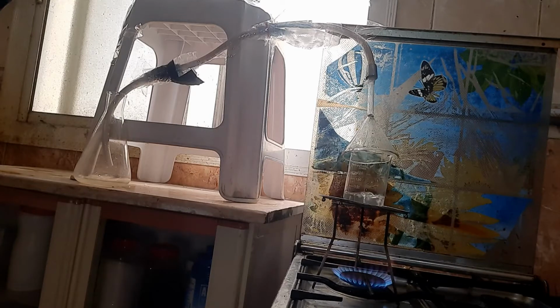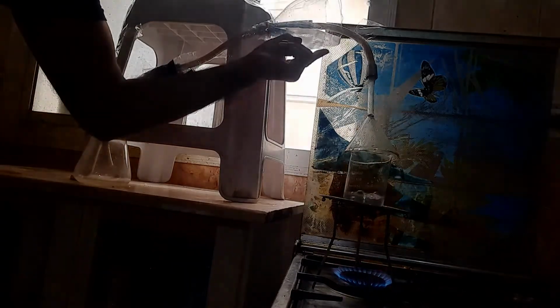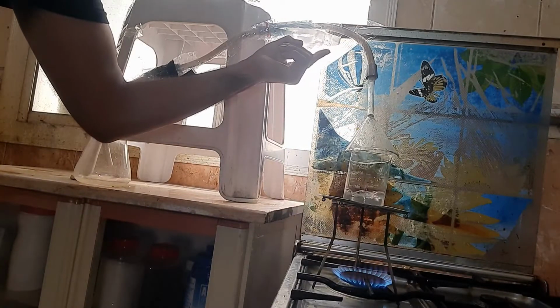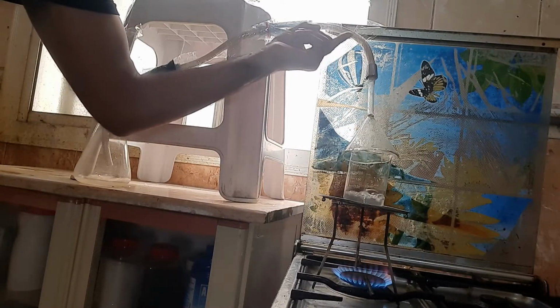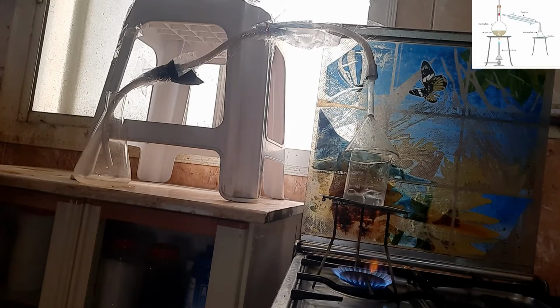I told you previously that these bubbles indicate that water is boiling. These bubbles are the water bubbles. This is the gaseous state. The temperature is fixed because all of the heat which is entering the water is just used to convert this water into the gaseous phase. And this condenser has ice cubes, and these ice cubes help the water vapors to cool down, to condense and convert into the liquid phase, and then you can see the drops falling down over here.